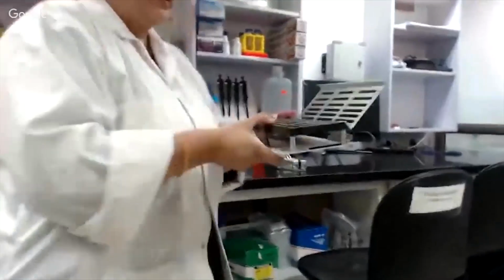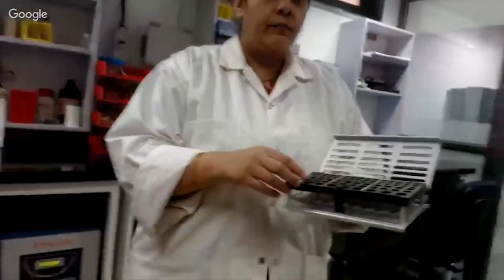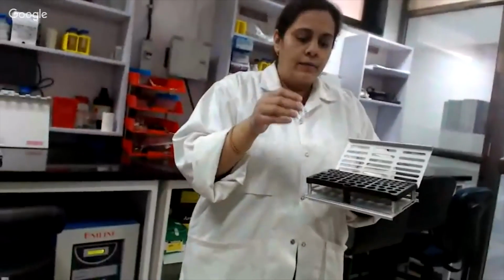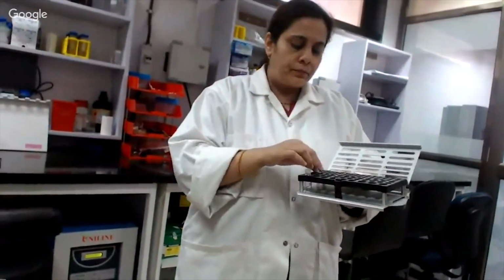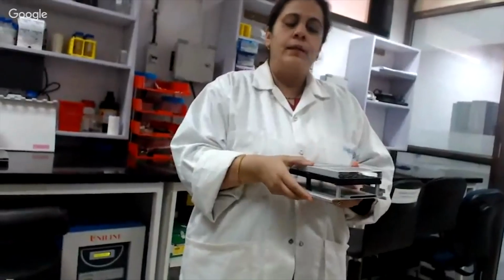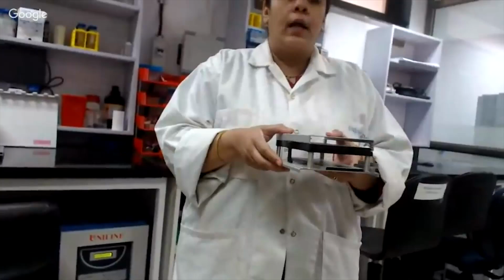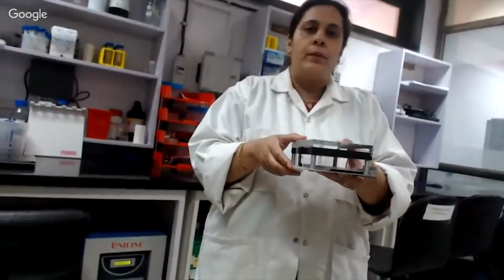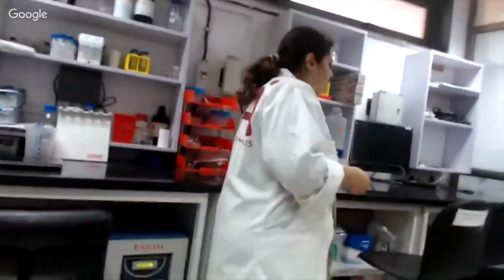And then we typically, this is a sample reagent rack where these are some of the vials where we can place our ligands, our analytes, our buffers, and then you close the rack and put it in the sample compartment rack. So we won't actually be able to show you how this is done because we have an experiment running, but you must have seen this in your Interactomics course, how the experiment is carried out. So now let's go straight to the data analysis part.